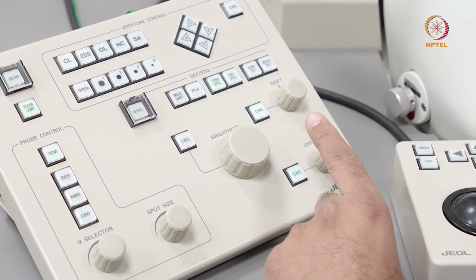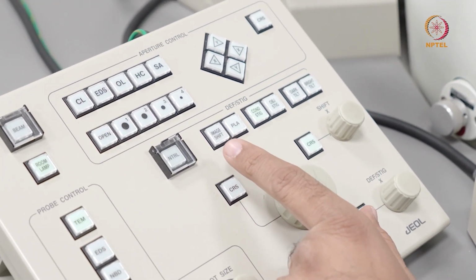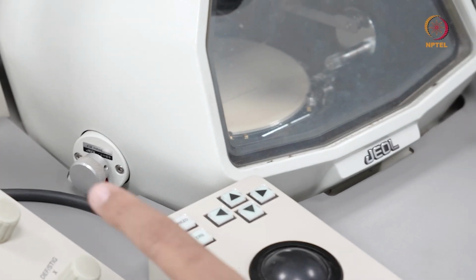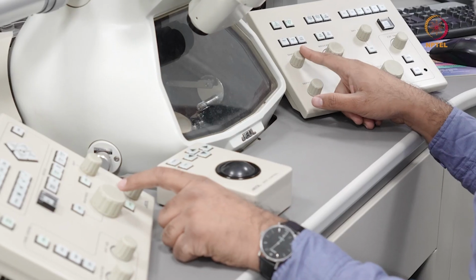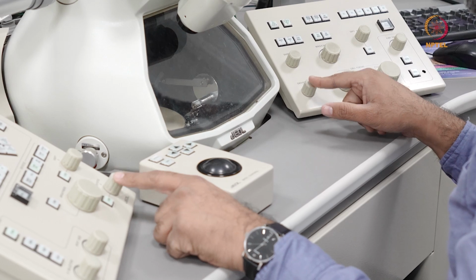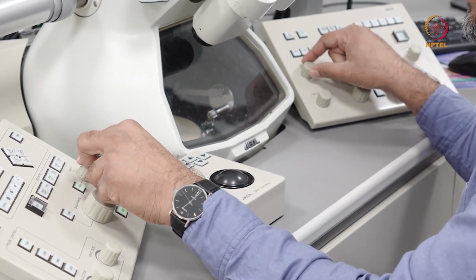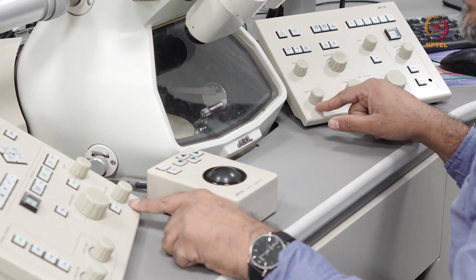Now, the other important knobs here are you have the deflector or stigmation knobs. So most important thing is, if you notice, I have to move from the left console onto the right console as well. I have two shift knobs, one on the left console and one on the right console. And I have two deflection or stigmator knobs on the left and right console. Now, on a Thermo Fisher microscope, instead of having these shift X and shift Y knobs, you have a trackball. And on a JEOL microscope, you have these knobs. And on a Thermo Fisher microscope, you call these deflection or stigmation knobs as multifunction knobs.